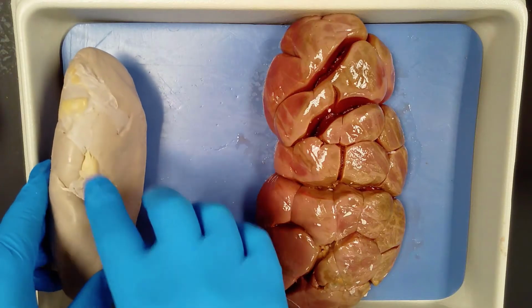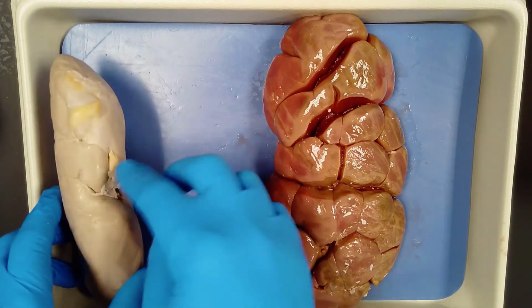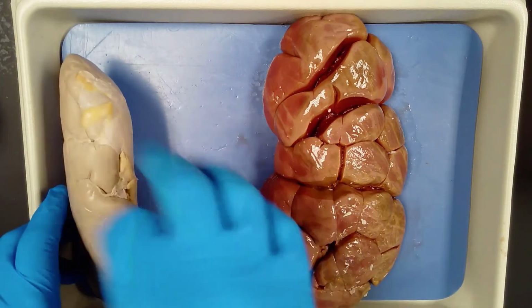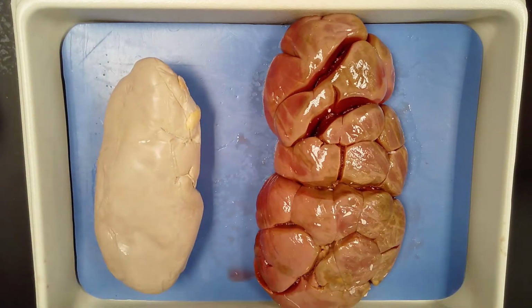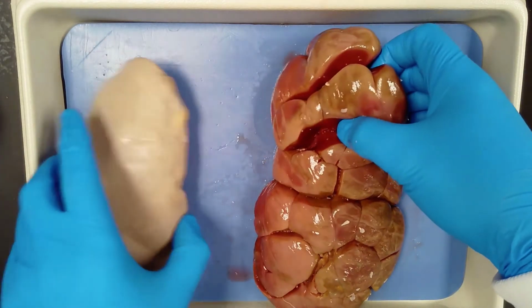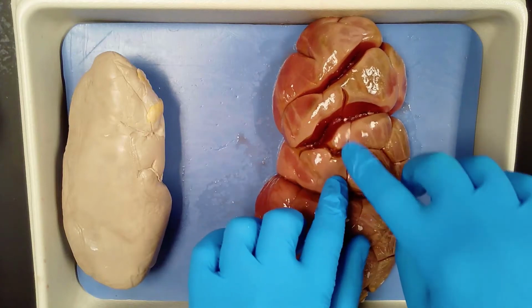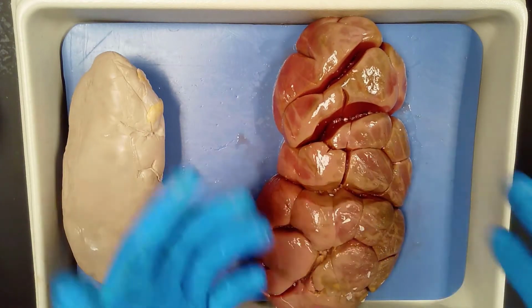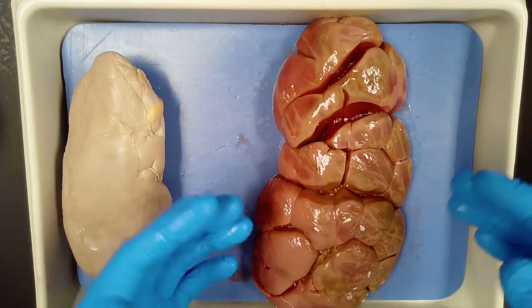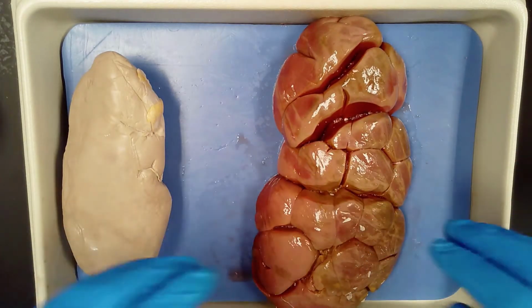You can see here, this is the medial portion of it. This is where the blood comes in, the blood goes out, and then the waste is brought out. Here is your cow kidney, and I'm going to move this over. You can see it's very red, and that's because it's very vascular, which means, what does it do? It filters blood. So that means there's a lot of blood in here, and that's where it gets its color. That vascular tissue is going to be red.